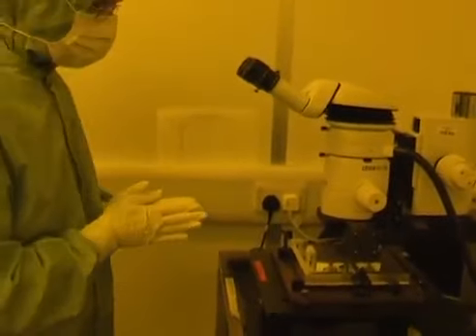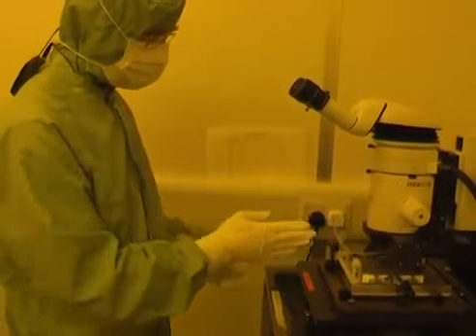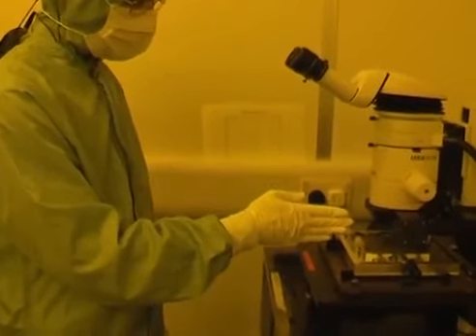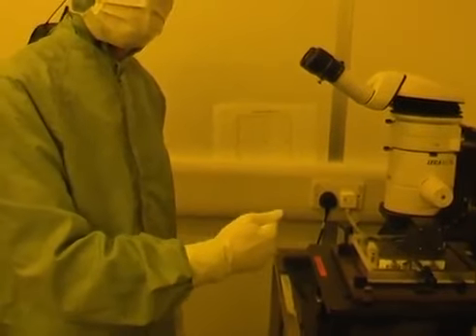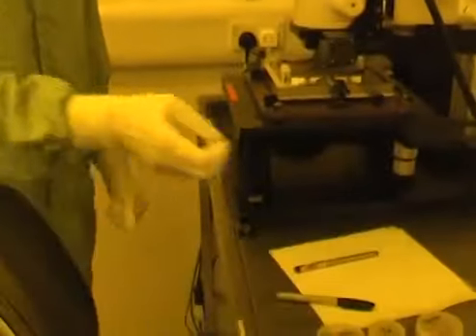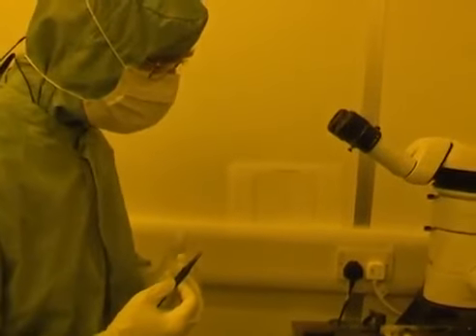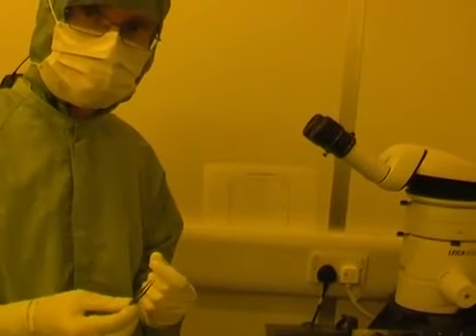Now, this is a manual operation, and what the operator has to do is to run the sample across its length, watching the crosshair and seeing how off true the rotation is. And then we can nudge the sample with a pair of tweezers until we get the alignment as close as we can. Now this sample is going to be particularly difficult because it's got two clamps.